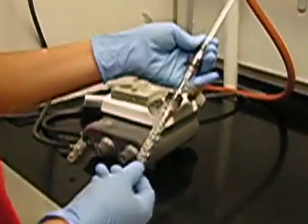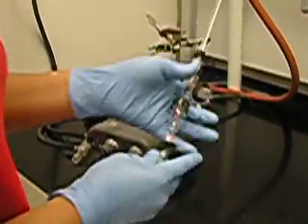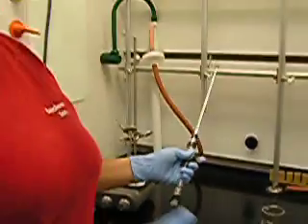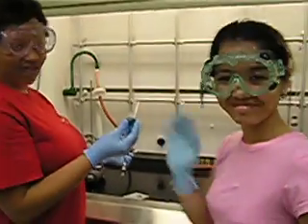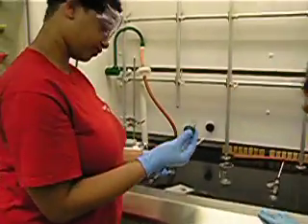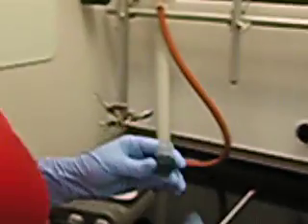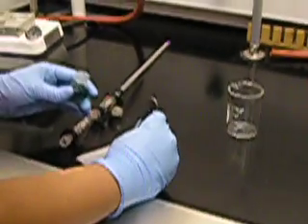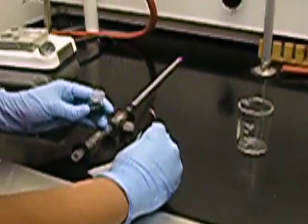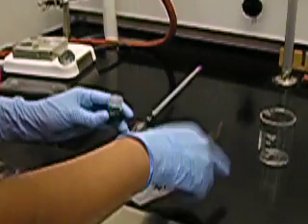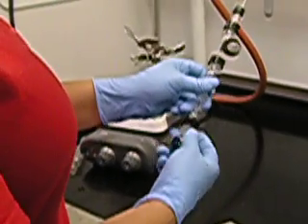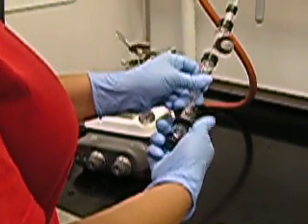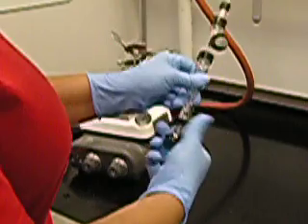While we were assembling this, once again we depended on our lovely lab partners to go and find our round bottom flask and appropriate solutions. We want to make sure that there are a few boiling chips in the round bottom flask, and then attach the round bottom flask to the bottom of the distillation column as well.